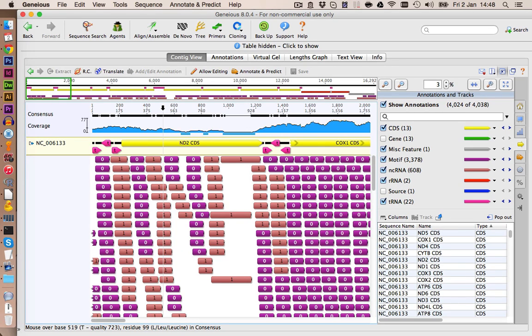This gets really complicated because our sequences are only 100 base pairs long, so it probably takes a lot of iterations, and also the BLAST algorithm has a harder time assembling short reads than with, for example, 454 data, where reads are often longer than 400 base pairs.